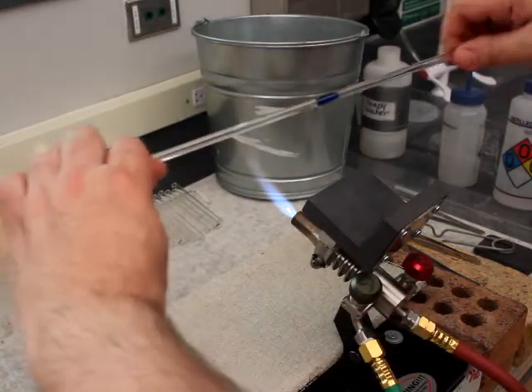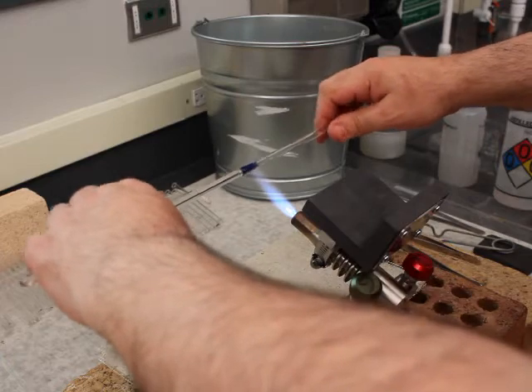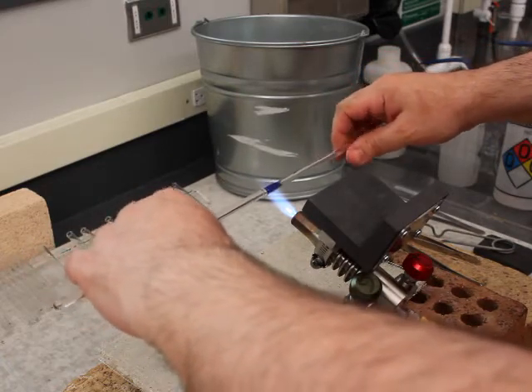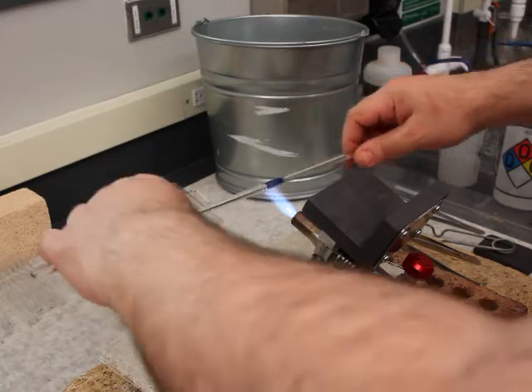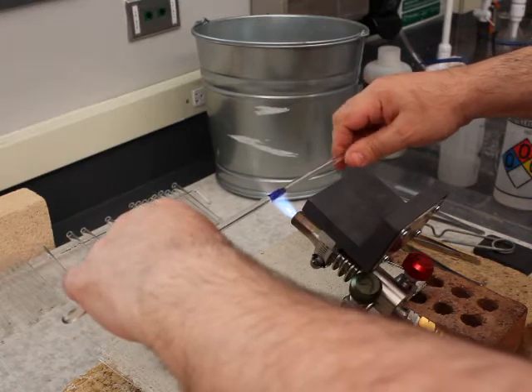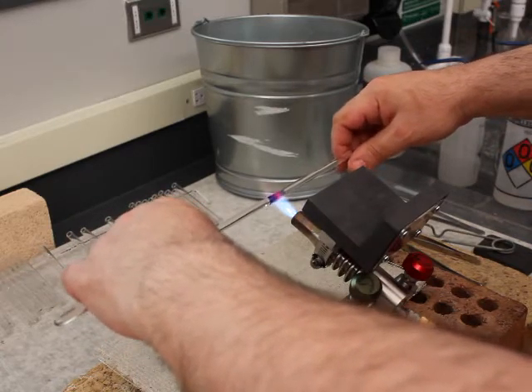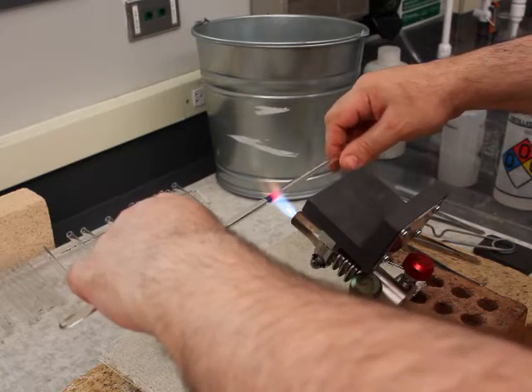In this video, I'm going to demonstrate a couple techniques. So the first one, I'm going to be pulling a glass fiber. This is also known as pulling a stringer in the artistic glass community. The goal is to heat up a section of glass uniformly, and if you notice, my hands are rotating the whole time. Then I'm going to draw it out into a uniform diameter.